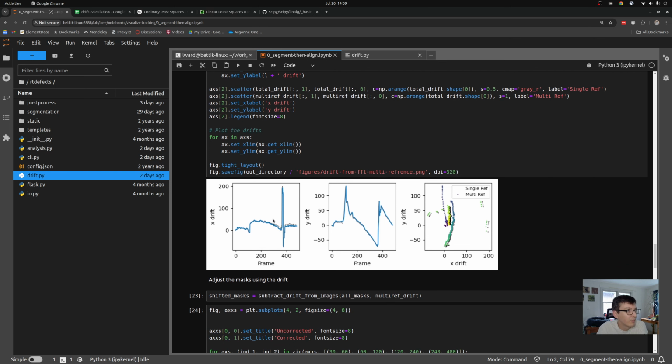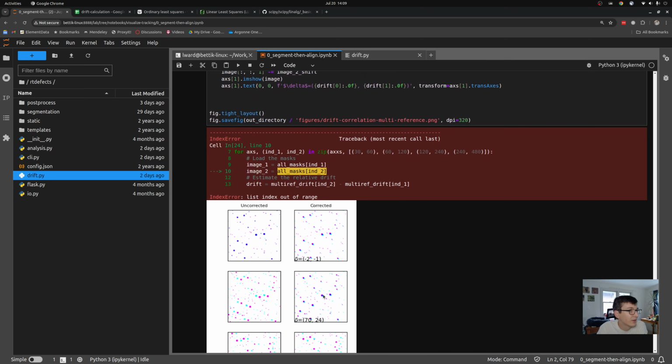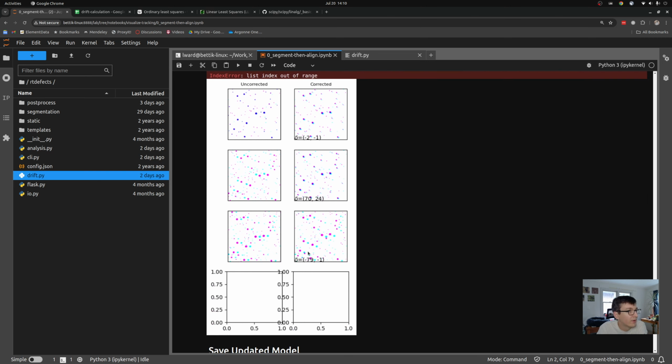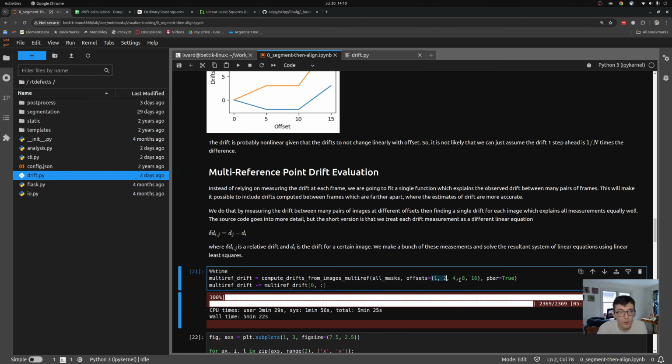So here you can see I get basically the same answer with my multi-reference drift method, and it does a fairly good job. You can see these images here are pretty far drifted from each other, and it aligns them up pretty well. There's still some issues. I probably need to tweak this algorithm a little bit more by selecting either fewer or more offsets to consider when calculating the reference points, but that will be a problem for another day. I've got at least the basic code together, and it's relatively fast. So I can try out many different opportunities.